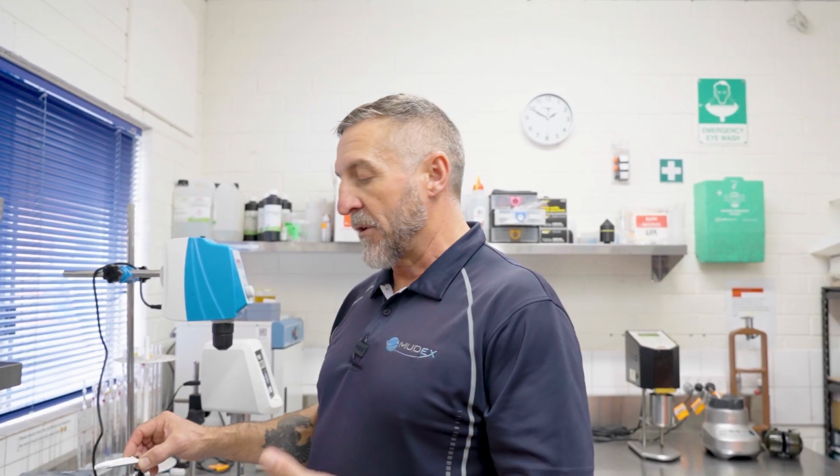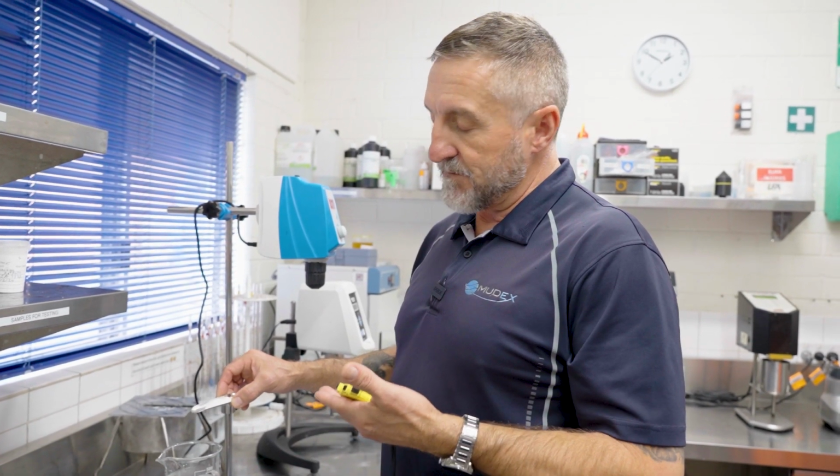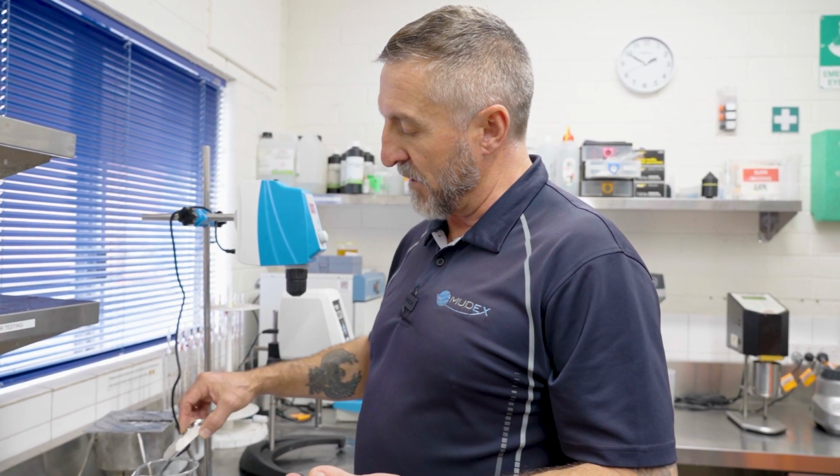This product here, if I was doing this test, I wouldn't even bother doing it at 30 seconds. I'll scrap this. I'll now do it at 5 minutes in the magnetic stirrer to see if we get a little bit better dispersion, because I know that that is not even remotely dispersible at 30 seconds. So I would try straight to 5 minutes and see what it comes out like. Once again, we tried the test at 30 seconds, this product not being a dispersible pack. We'll redo the test at 5 minutes, and if we get similar results, then we will follow the same testing.